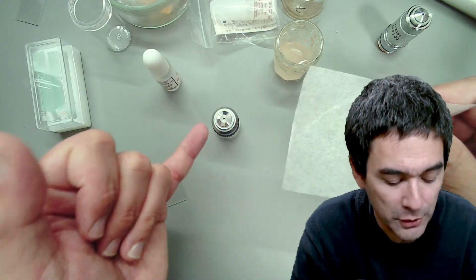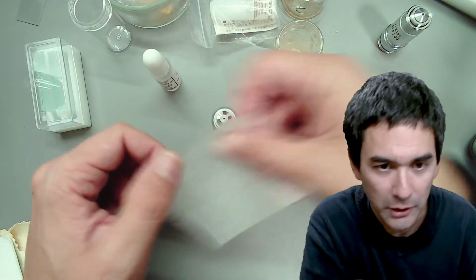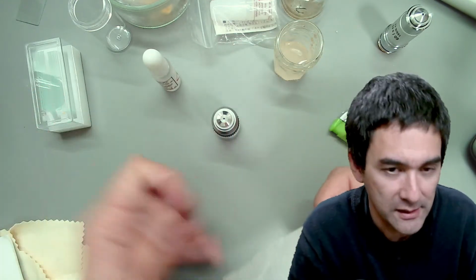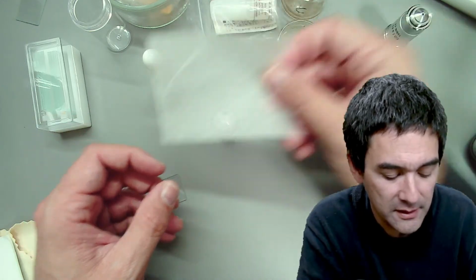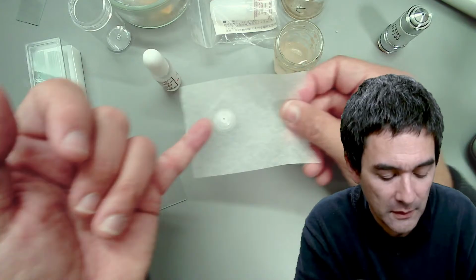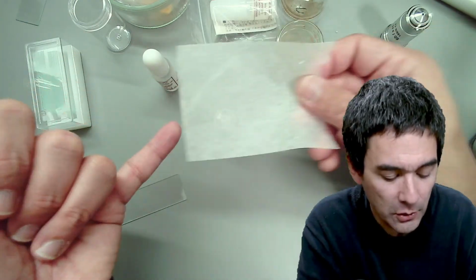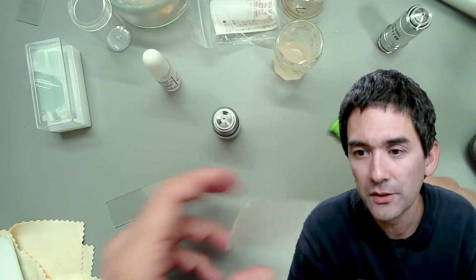Why without pressure? Because if there is any dust on here, and you start rubbing it, then you might actually make scratches on the front lens, okay? So the idea of removing it like this is to prevent any solvent from flowing in, and also to make sure that there is no pressure.